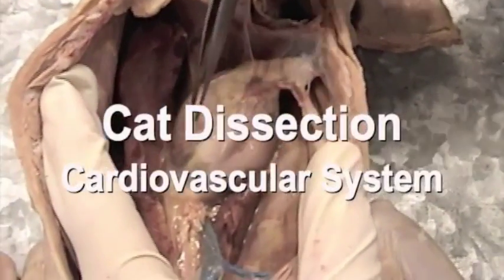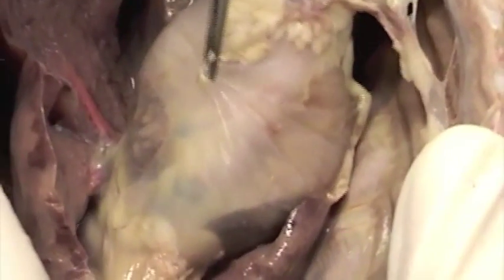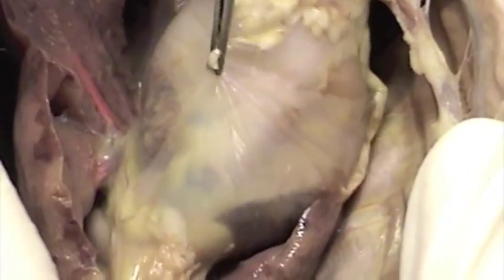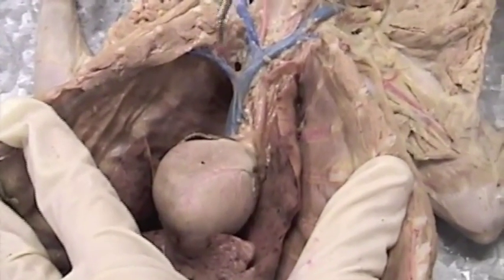All right, here we have the heart in the thoracic cavity, and it is surrounded by a pericardium. I am holding the fibrous layer of the pericardium in the forceps here. You can see the sac, the pericardium. We're in the thoracic cavity of the cat.